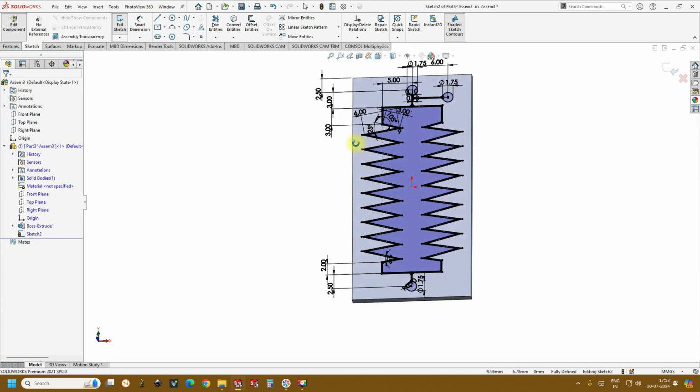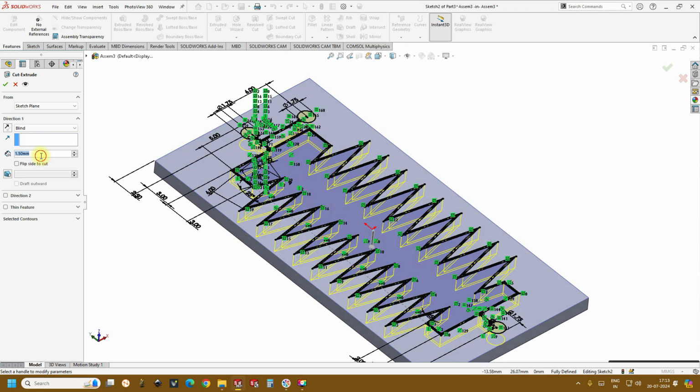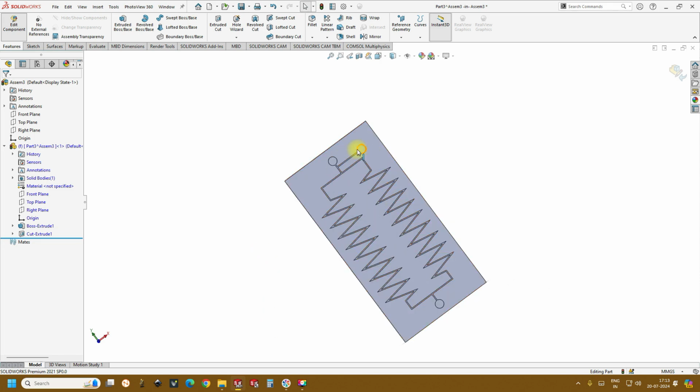So now the design is ready, and the next part is go to features, extrude cut, and the channel height we will maintain at 0.5 mm or 500 microns. Click OK. So this is how we see the double split, the mixing of two regions, splitting and mixing inside the zigzag channels, and the resultant will be collected from the output. So these are two inlets and one output.